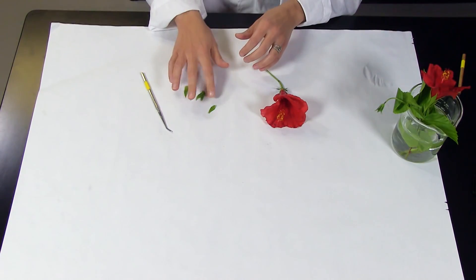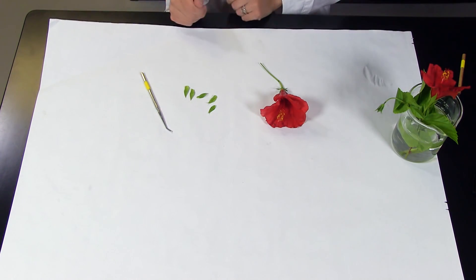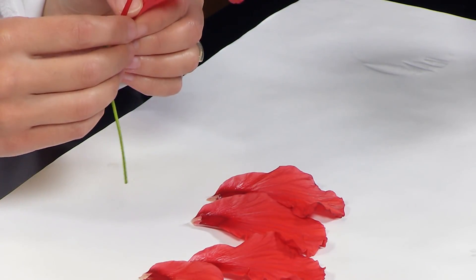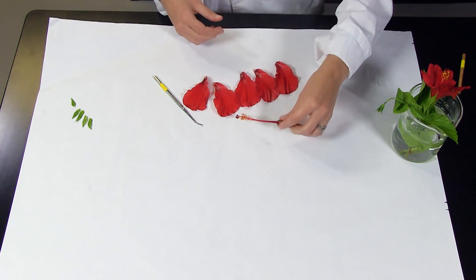Keep the parts of each flower separate. Set the sepals of each flower aside to be presented with your dissection pictures. Next, do the same for the petals. Again, set these aside keeping the petals of each flower separate.